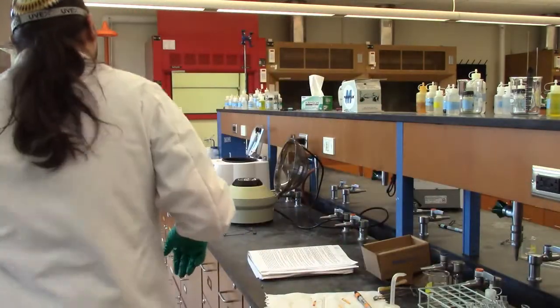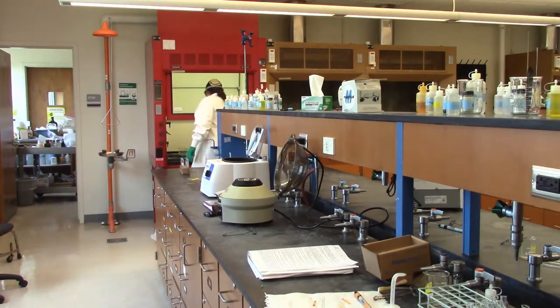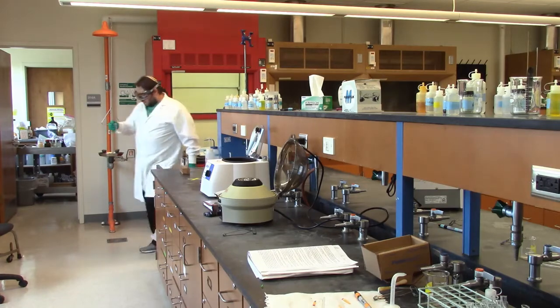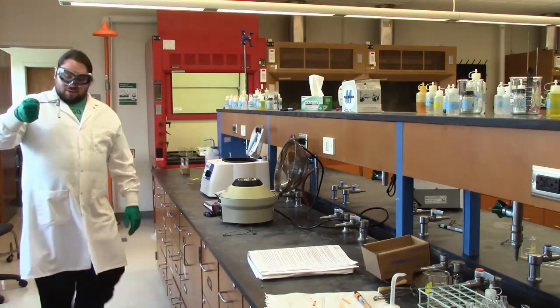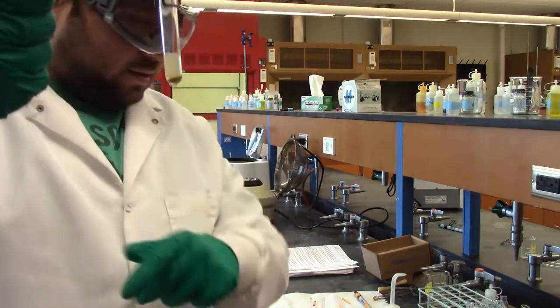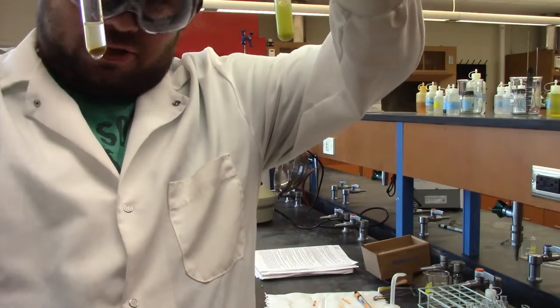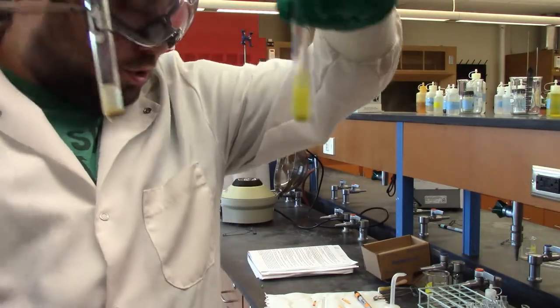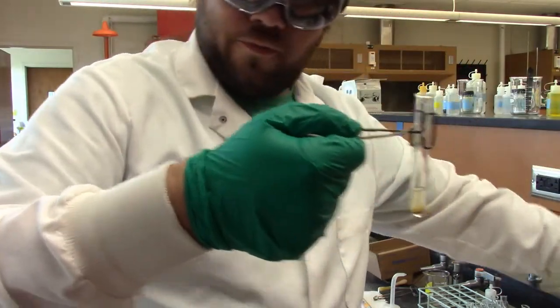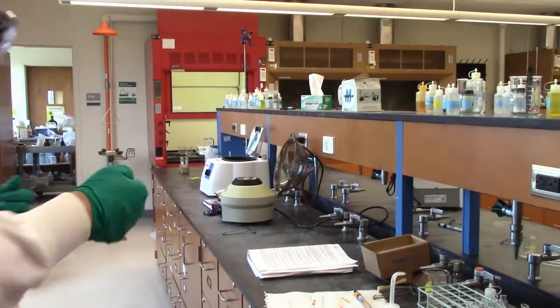Before we cut though, I do want to show you really quickly. While we're filming, the tin came out, so I just want to show you that nice clear tin that we got there. So there's our tin. And there's our cadmium, and if we let it sit for a while, it'll also probably just settle to the bottom, and I'll show you that later if it happens. So, next, we'll do the precipitate and get our copper and our bismuth.